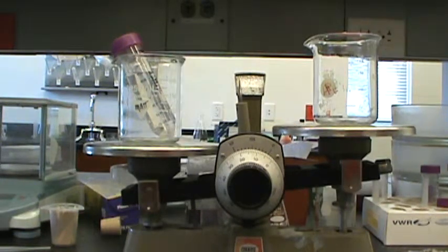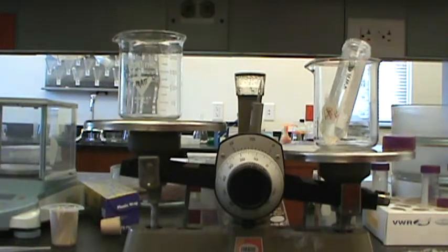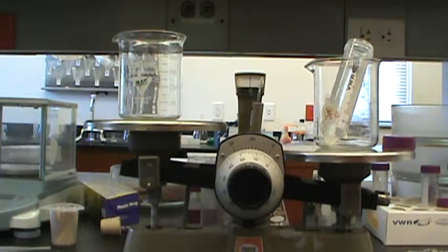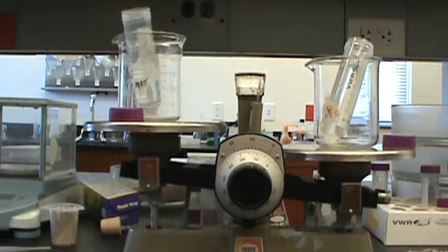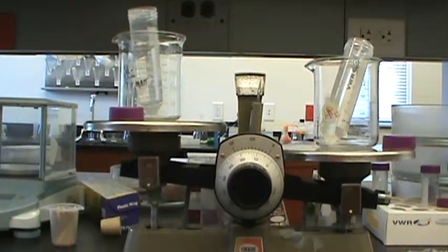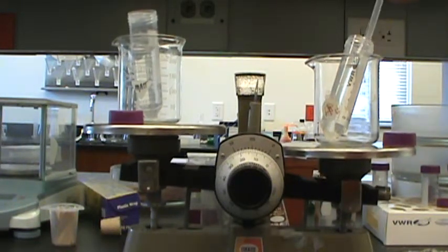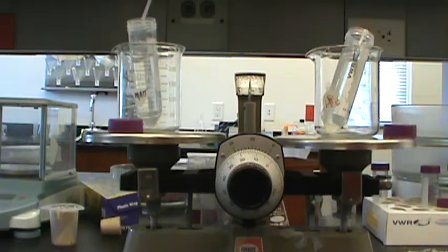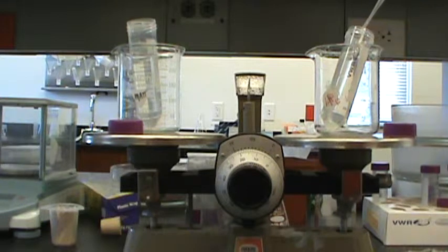we have to balance it with something of the same weight and put that directly across from it in the centrifuge. That's what this scale is for. If you're using samples that are the same, you can work with somebody else, some other lab group, and if you have about the same amount of material in there, simply transfer liquid back and forth until we get the tubes to balance.